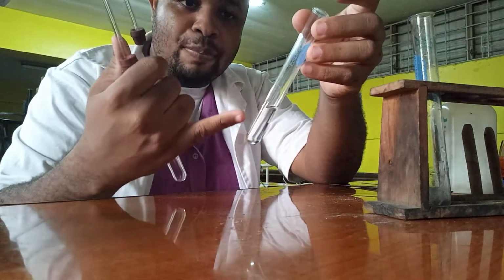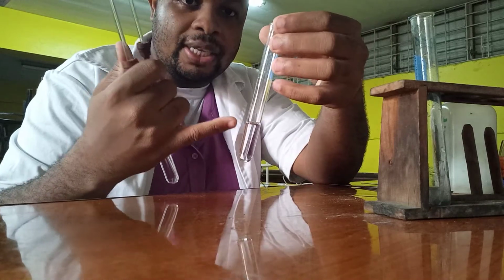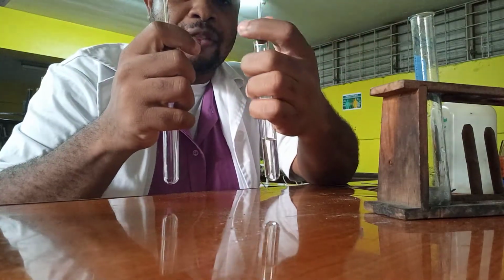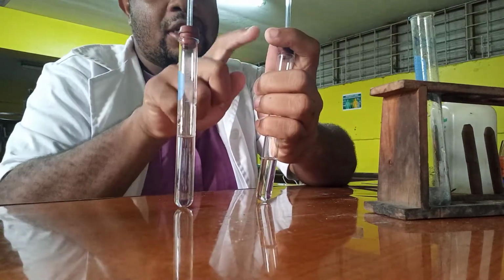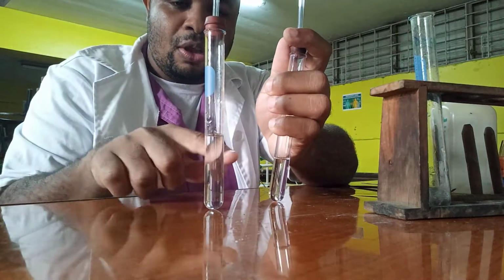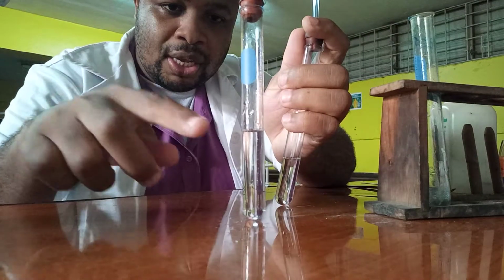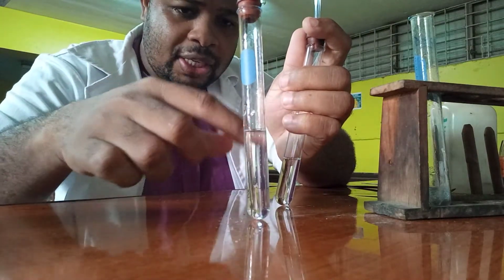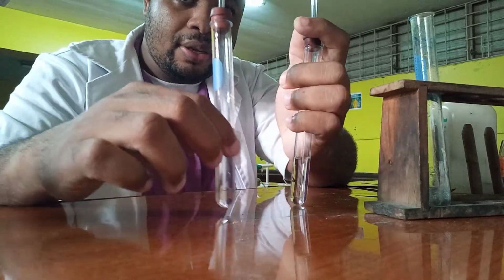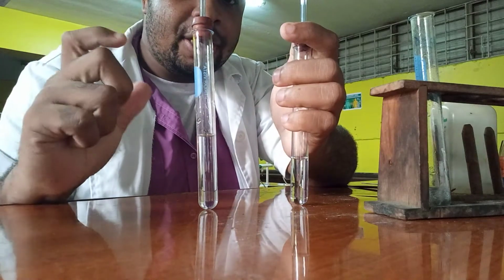So sodium carbonate plus the acid is going to produce carbon dioxide. It's a gas, so it will leave, but before it can leave, I'm going to place this over it. It should travel through this tube and go into this test tube with the calcium hydroxide. Once you see a white precipitate, once you see that color change start to occur and it gets white, it's a sign that carbon dioxide is being produced.